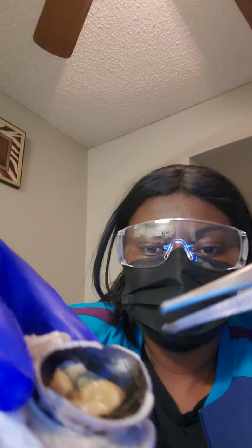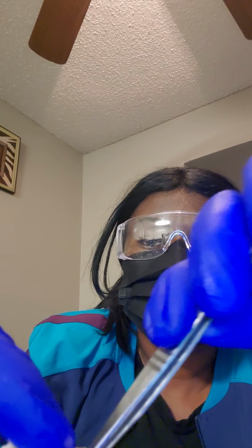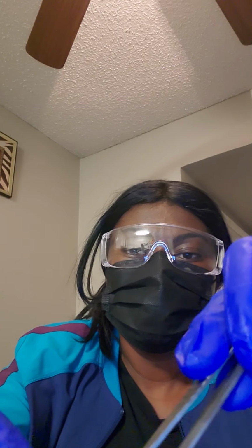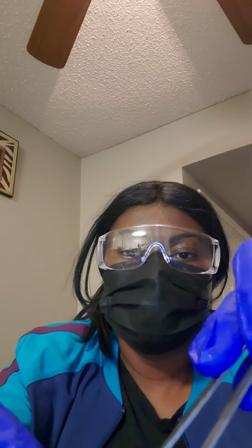And with that, this is the yellow right here. It's the retina. And then this hard part of the eyeball is the sclera, and the sclera keeps light out.